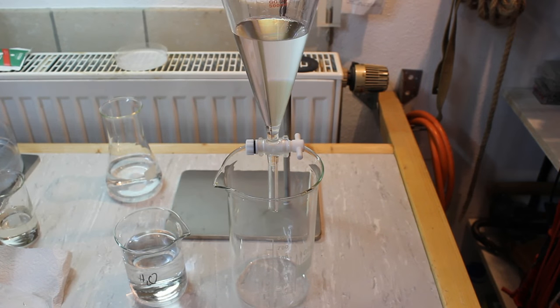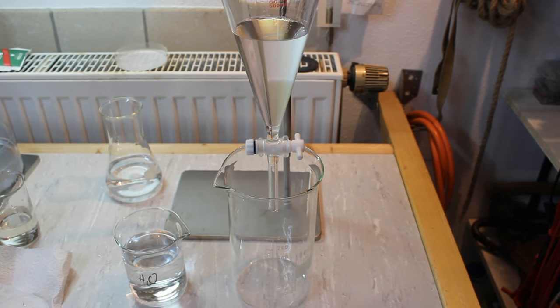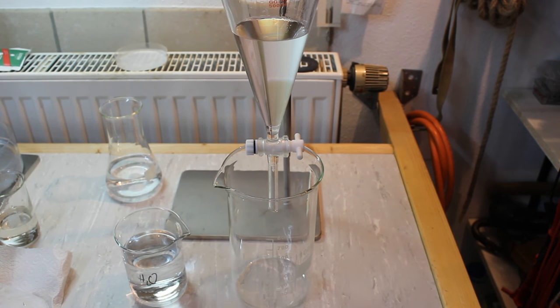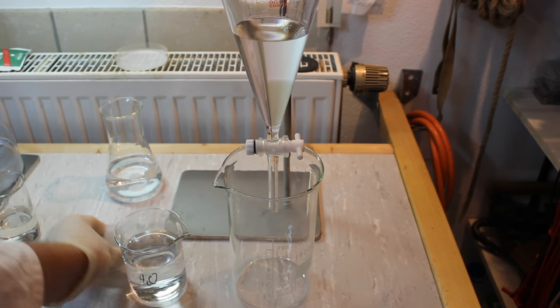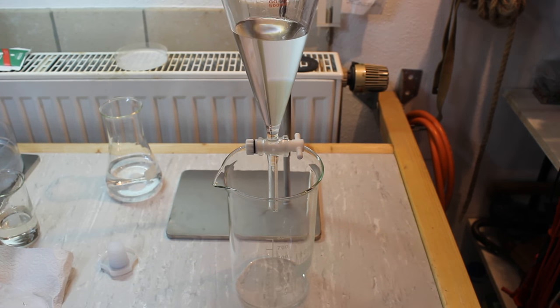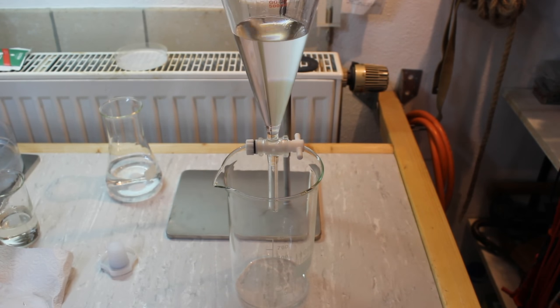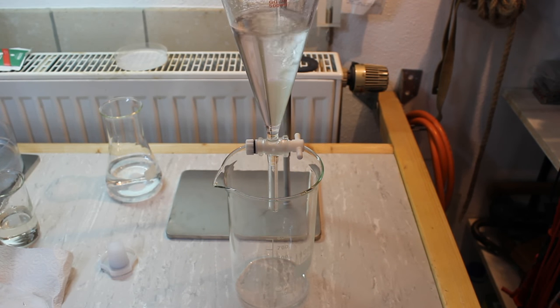After the second sulfuric acid wash we will do one water wash. The water should be the top layer this time.